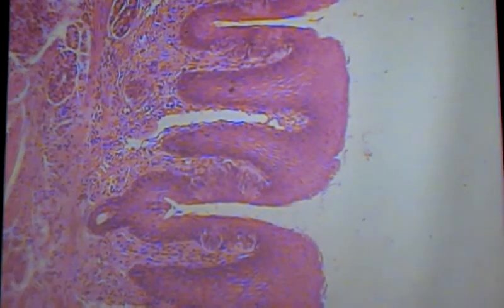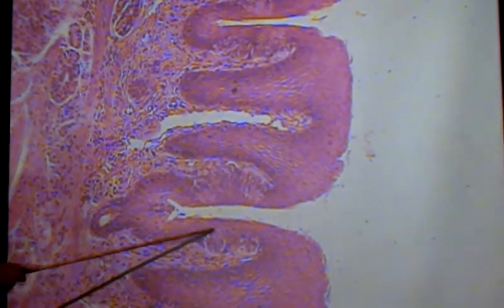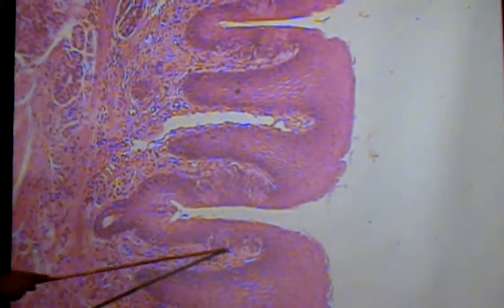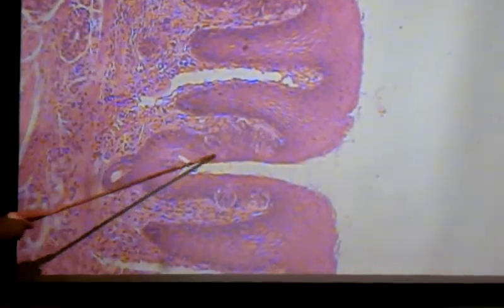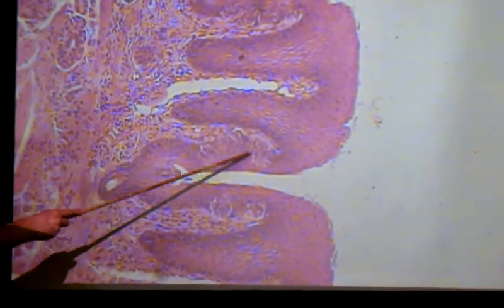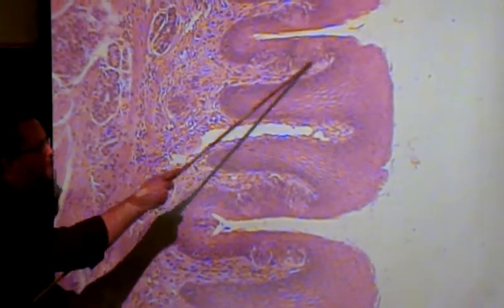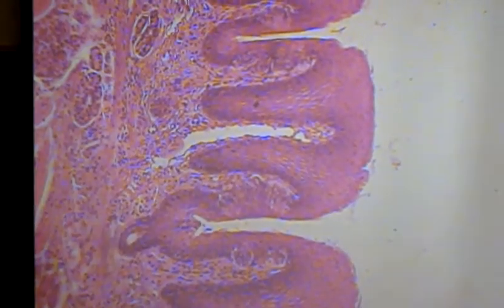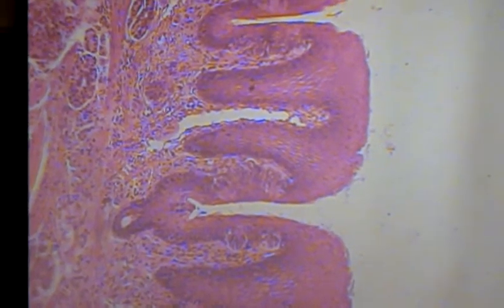So again, mine aren't the greatest, but here is one taste bud right here. Here's another one. It looks like there's the edge of one here. Another one here. There's one. There's one. There's one. Getting the idea, you guys? Yep. So they are on the sides of the papillae.